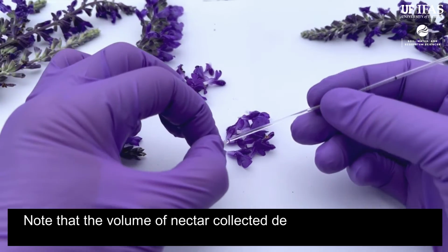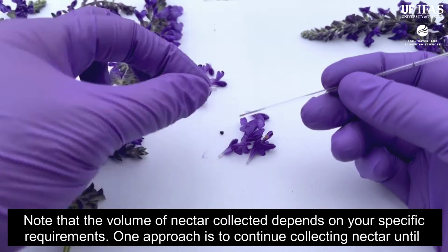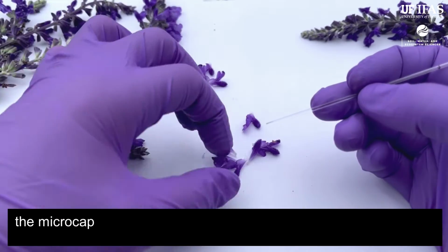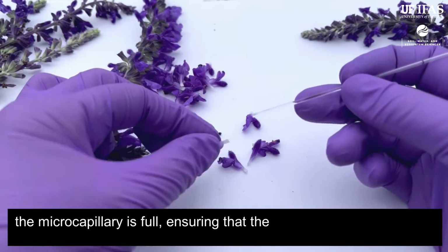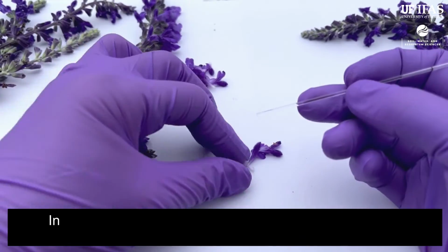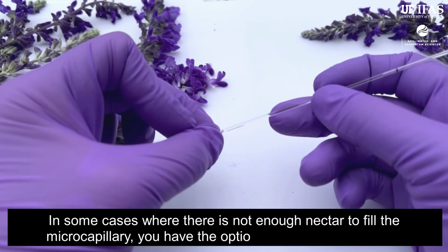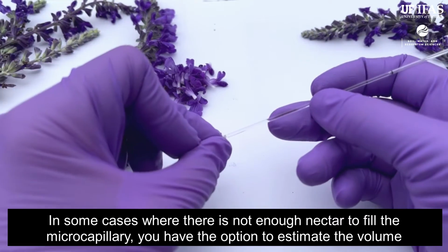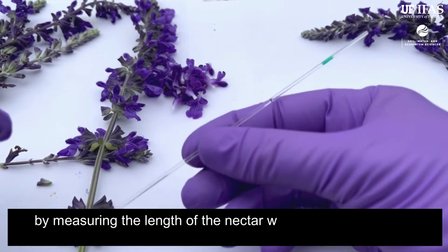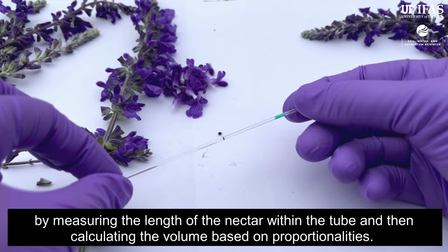Note that the volume of nectar collected depends on your specific requirements. One approach is to continue collecting nectar until the microcapillary is full, ensuring that the volume collected matches the tube's volume. In some cases where there is not enough nectar to fill the microcapillary, you have the option to estimate the volume by measuring the length of the nectar within the tube and then calculating the volume based on proportionalities.